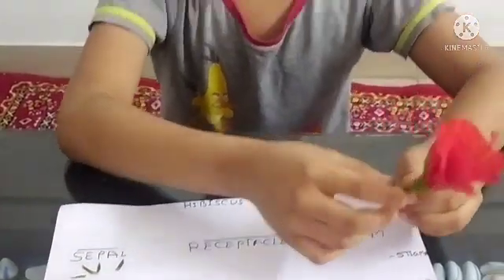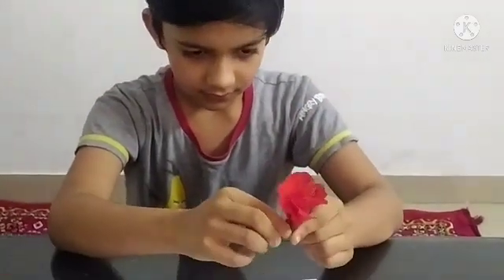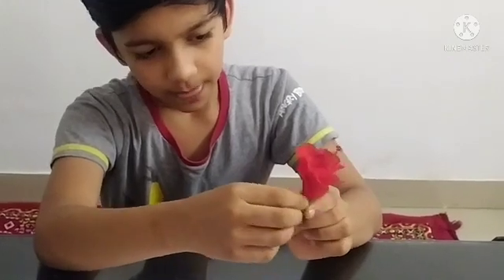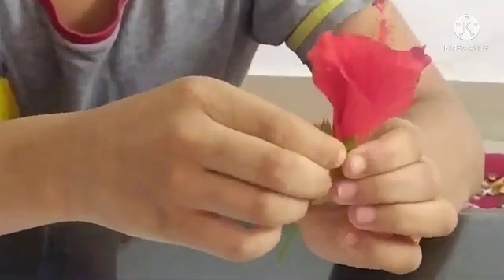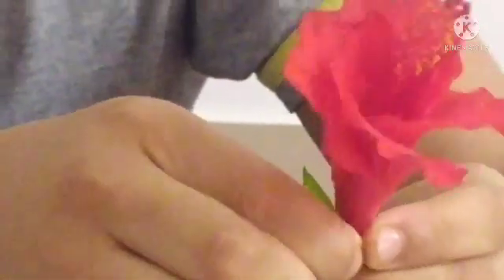Now we will take out our receptacles from here. First you have to tear from here and then take out like this. When you take it out, it should look like this.